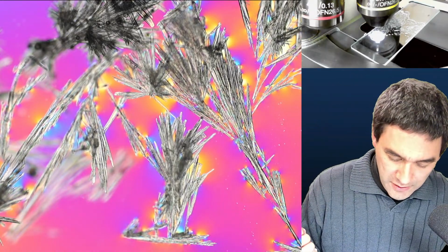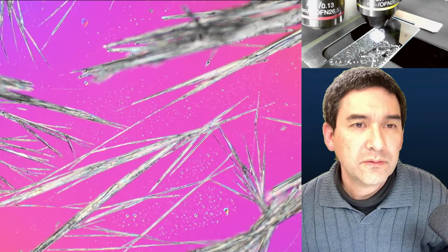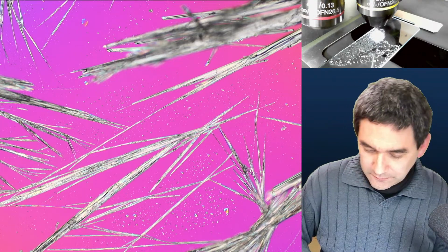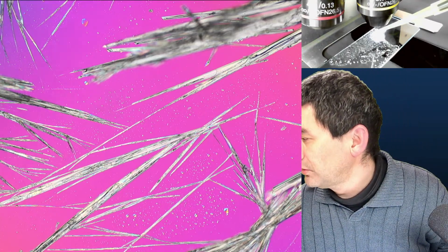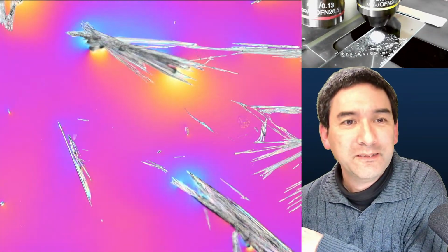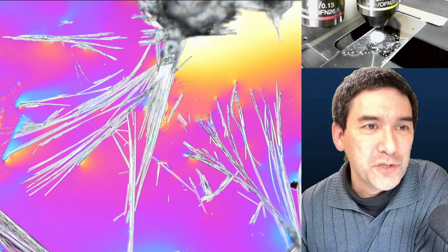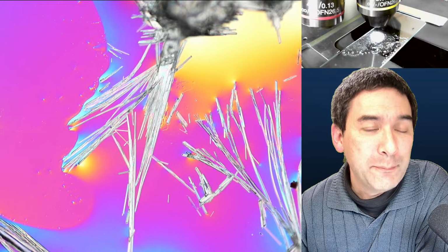As a little comparison, on the other side here, I would like to add a little bit of alcohol, and then let's see how it dissolves in alcohol. So I need to do the following. So that's just regular alcohol. And here we go, just a second, 3, 2, 1. Up, and I think that made it very clear. Look how quickly it dissolves. The crystals disappear one by one. And the alcohol also evaporates, you see?